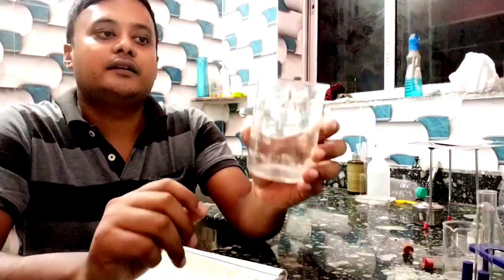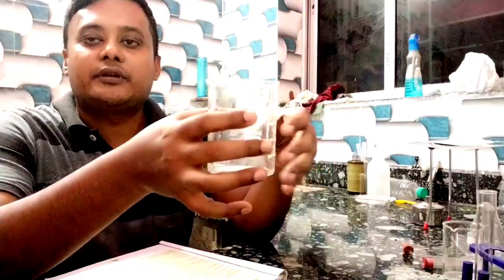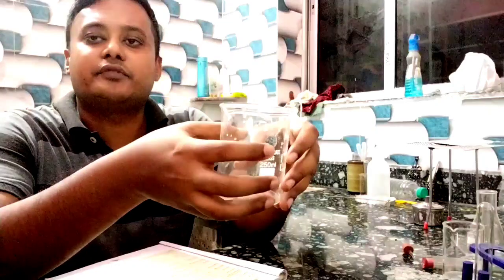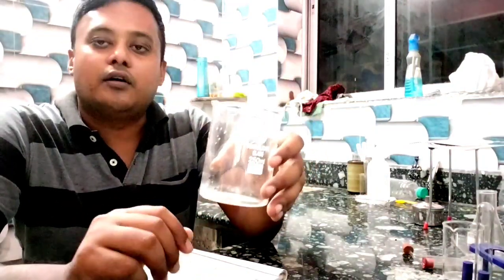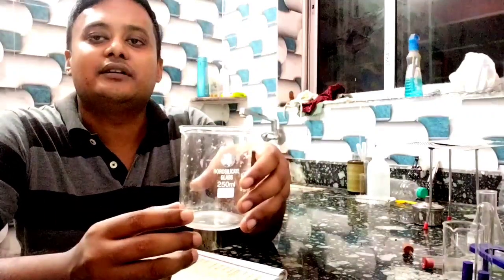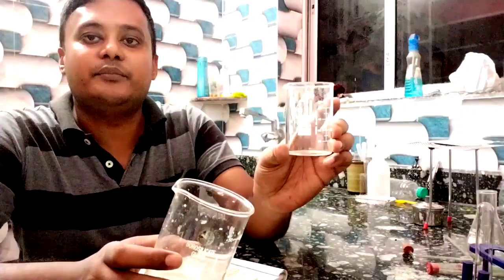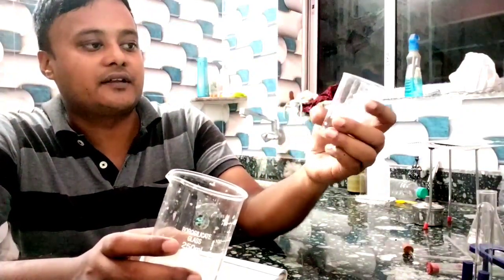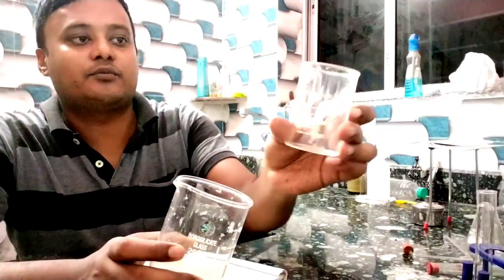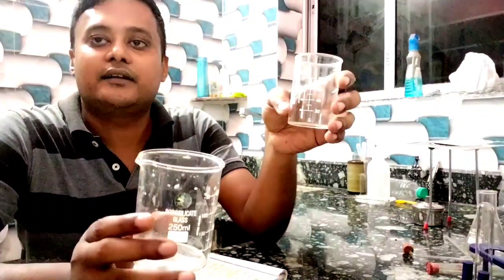Next one: beaker. It has a rim and a mouth to transfer any chemical. We keep liquid in it, use it for heating, mixing, or stirring chemical reagents. It is available in many volumes — I have a 100 ml beaker with markings at 20, 40, 60, and 80 ml, and also a 250 ml beaker. All are made of borosilicate so they can withstand heat.